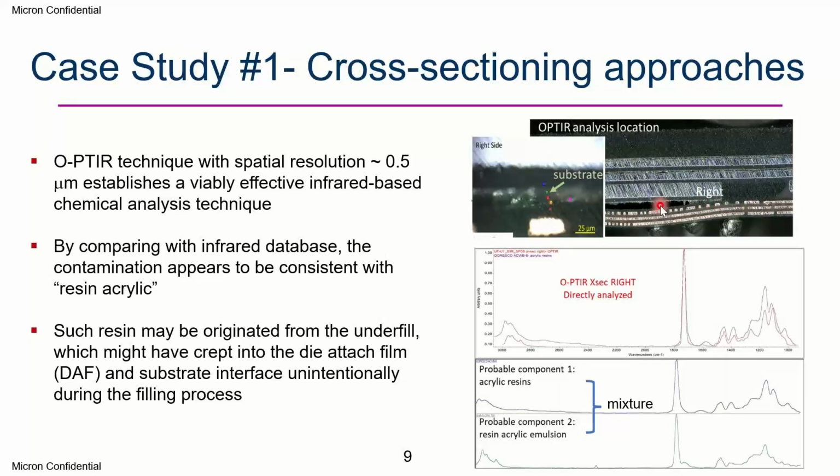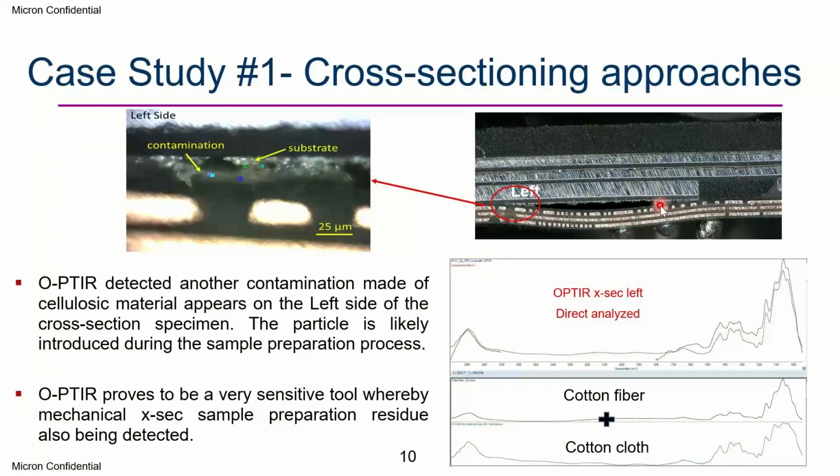Then another interesting part we can see from OPTIR during this mechanical cross-section analysis. You see we also did a left-side analysis, because just now was the right. Now we do the left, and surprisingly we see a spectrum that is also a very solid, real spectrum. Once we match with the database, it comes out with cotton fiber and cotton cloth. This is very interesting. The reason is that during the mechanical cross section, the failure analysis team used a cotton cloth to do the cleaning.